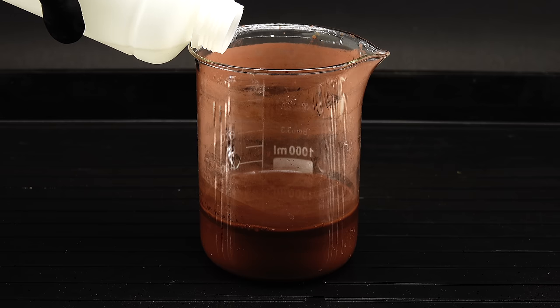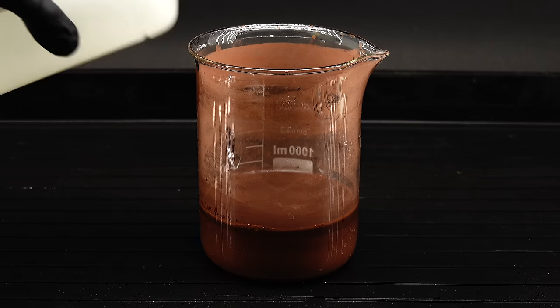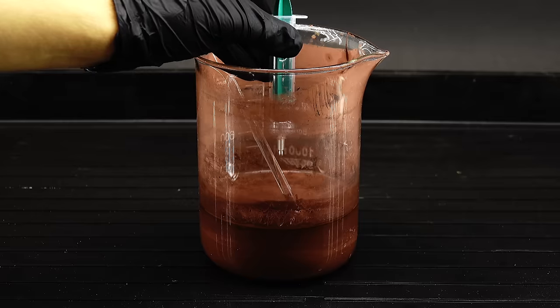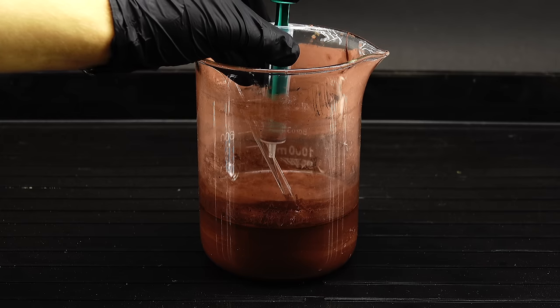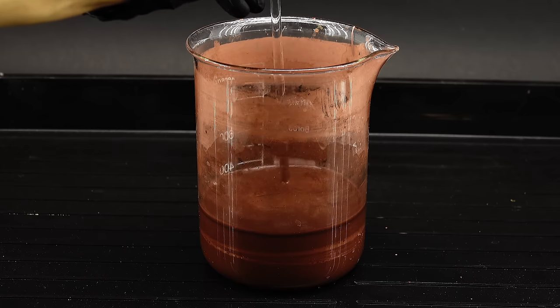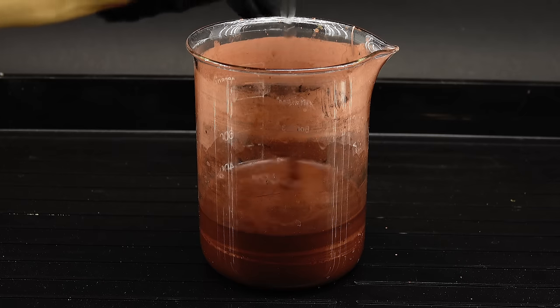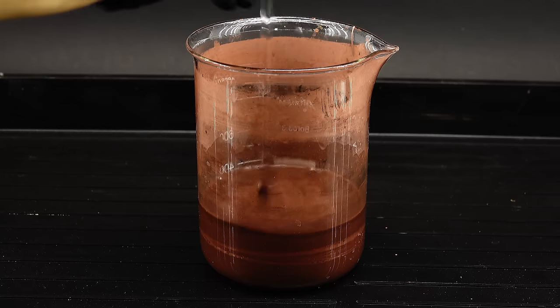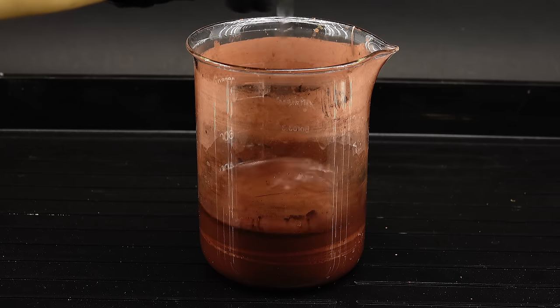To start, I first added a few milliliters of the acid into the copper slurry, along with the previously made dry copper powder. I also added in the pre-measured 80 grams of mercury, and started mixing everything. At first, I thought that after a few minutes of stirring, the mercury would absorb all the copper, but to my surprise, after stirring this thing for like 20 minutes, nothing seemed to happen.